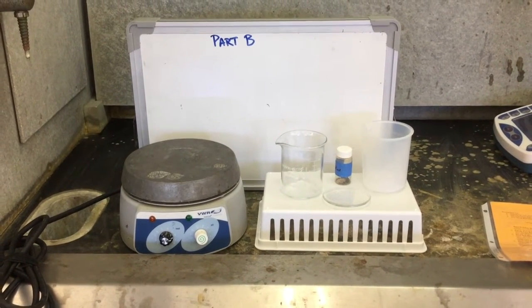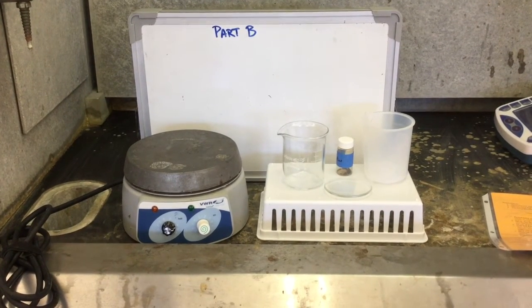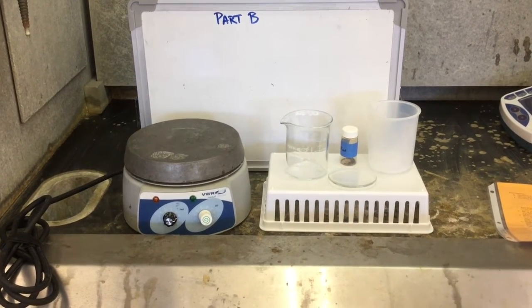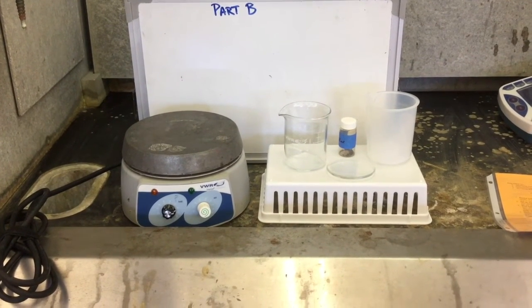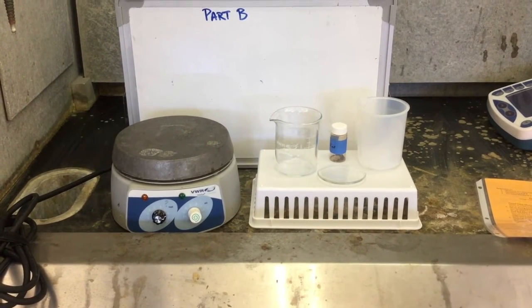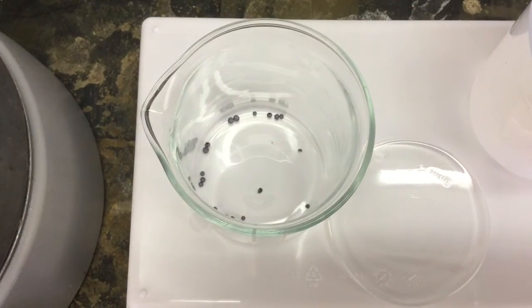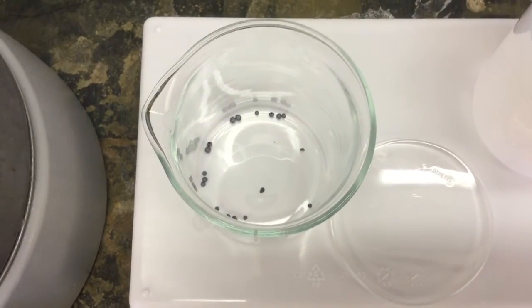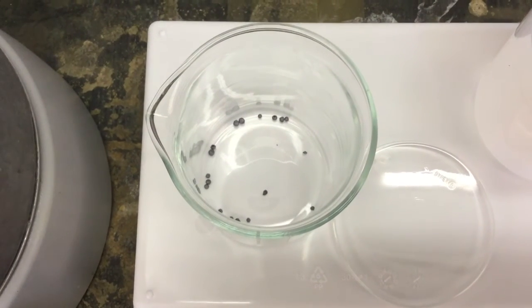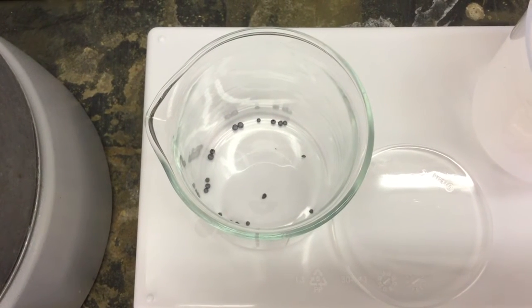Your iodine vial may still be clear, or it may have become dark from reaction with the iodine. When you open it, you may notice that the iodine may have corroded the lid as well. Iodine is a strong oxidizer. From your drawer, bring out your 250 milliliter beaker and your watch glass. Place a few crystals of your iodine in the beaker. Make sure to record your observations before you begin the experiment. Observe closely because the iodine actually has a color to it other than just silver.